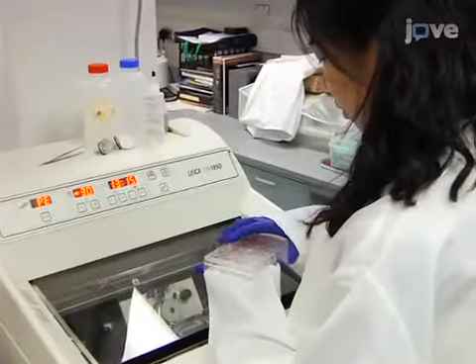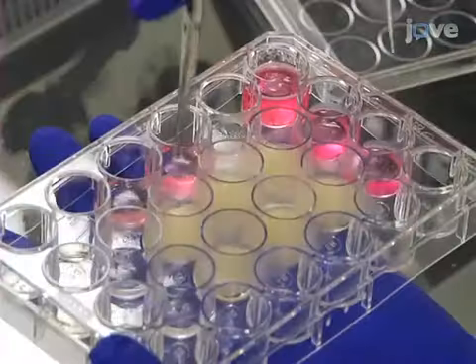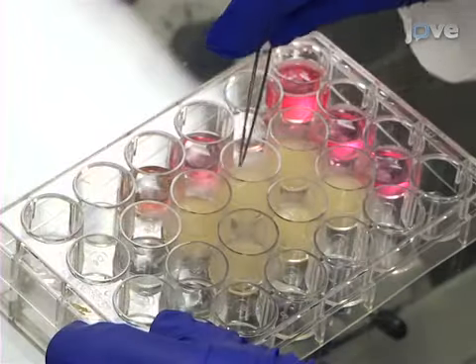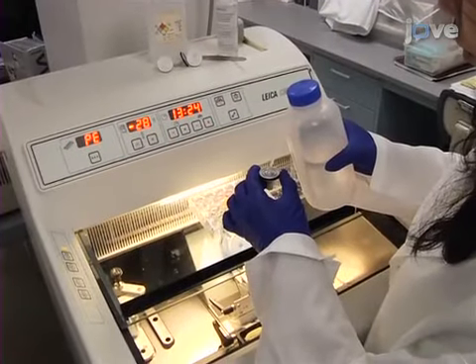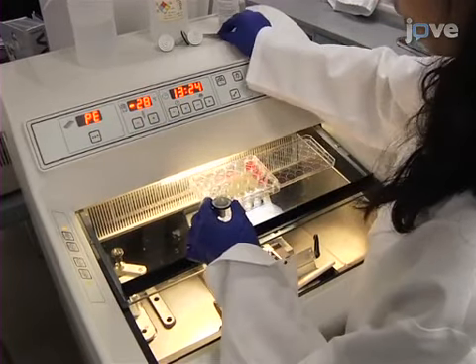Once the 24-well plate containing the cell cultures has been removed from the freezer, warm the bottom of the plate with a hand until tweezers can slide gently down the side of the well. Next, smoothly slide the tweezers around the disc, freeing the gelatin without thawing the center. Add a drop of water to the cryostat support and adhere the gelatin disc to the support. Then place in the cryostat to freeze.